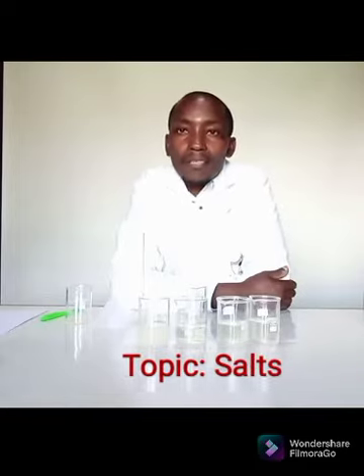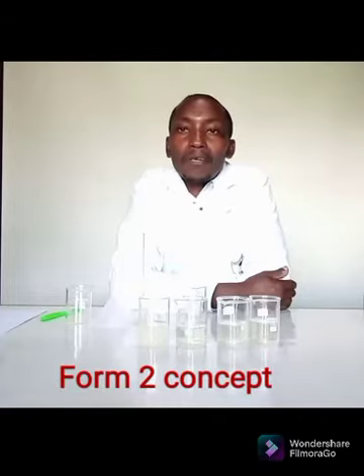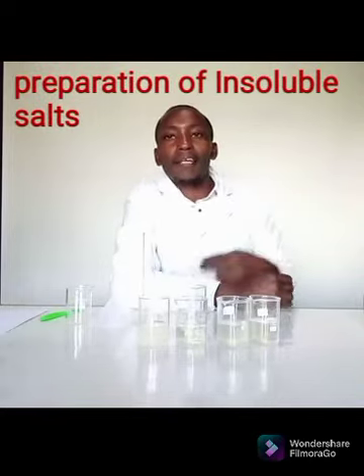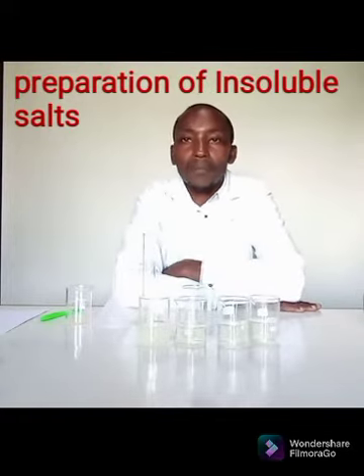Now, for today, we want to do something very simple. It is under the topic salts, covered in Form 2. So, what do we want to do about salts? We want to learn how to prepare salts, and specifically, we want to prepare insoluble salt.